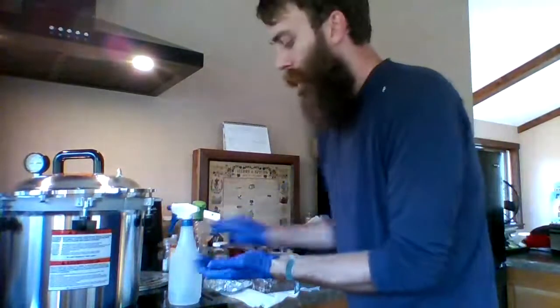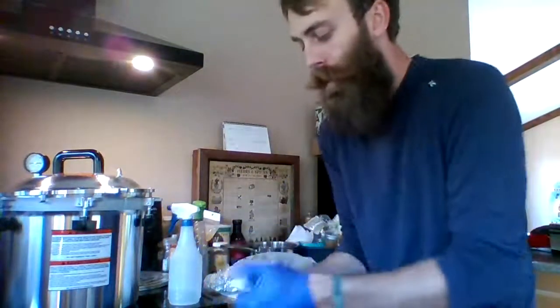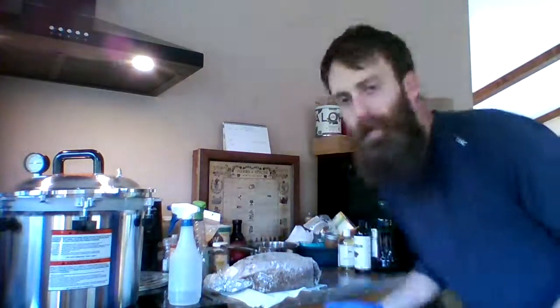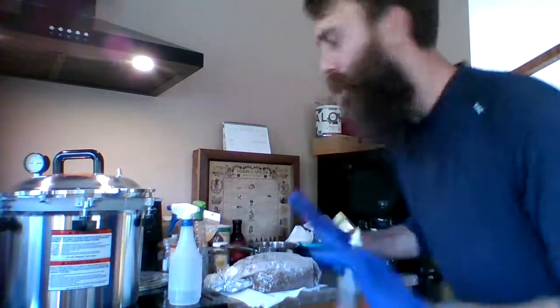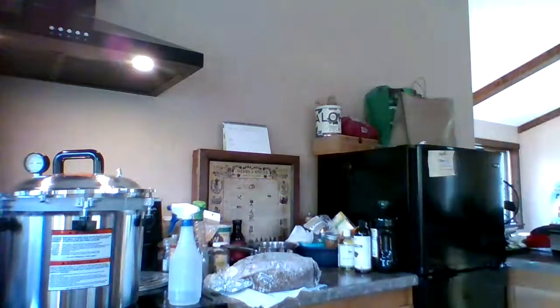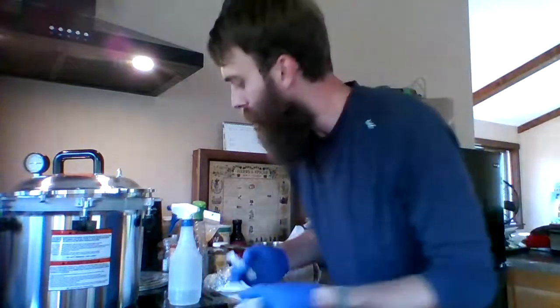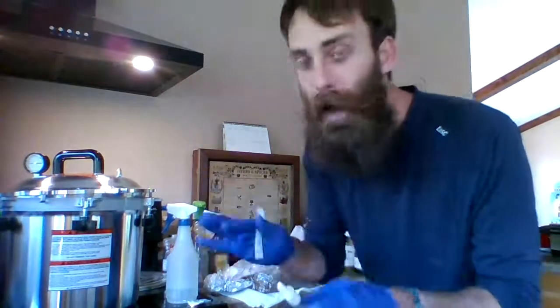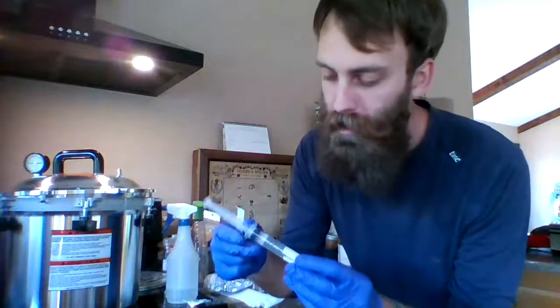Maybe I could put this up a little bit — no, down. More alcohol. This is probably going to be two videos worth, but whatever, I'll just keep it in one and see how that goes. I've got a little bit of tape on this fridge, and that's going to help me cap it when I'm done. This is the spore syringe — it's 10 milliliters, but we're only going to use two and a half.